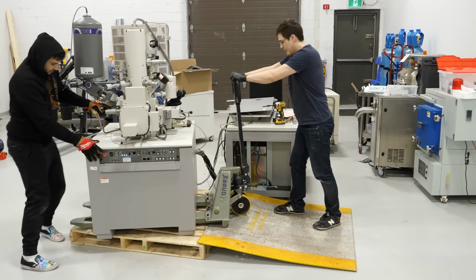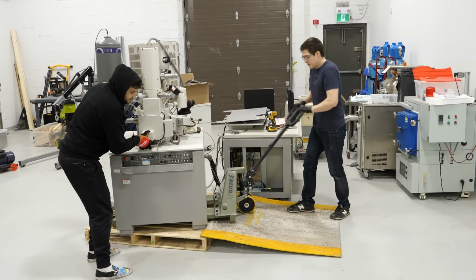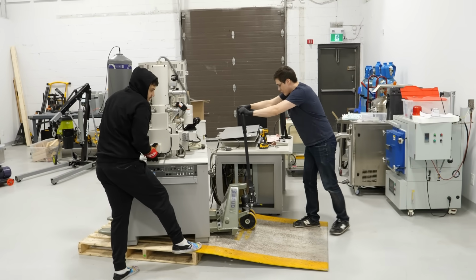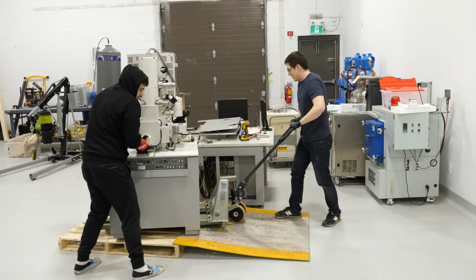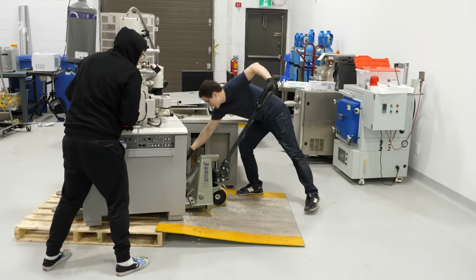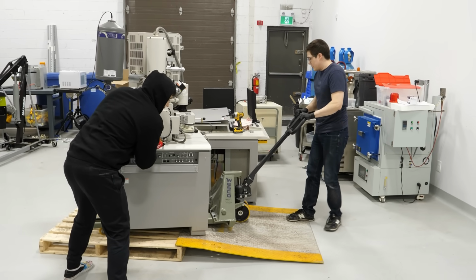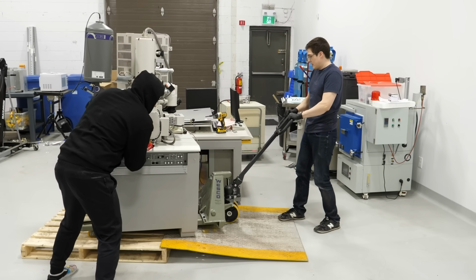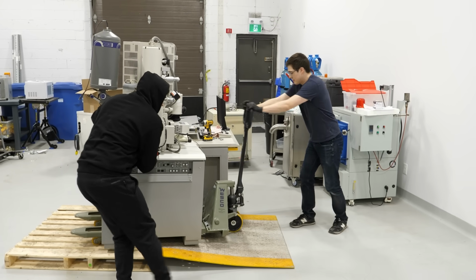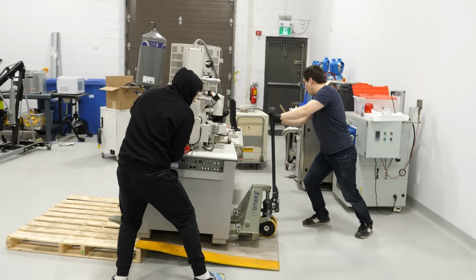Okay, now you gotta lift. Yep, you're good. Okay, you're good, higher. Your wheel's up there. One second. Higher, higher. Okay, now go, go. One second, it's gonna scissor this wire here. Just watch out when you're pulling it down. Keep going slowly. Higher a bit, just a little bit more. Okay, good. We're good. Oh! It's okay, keep going.